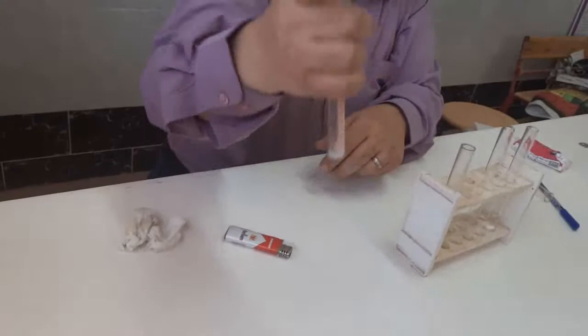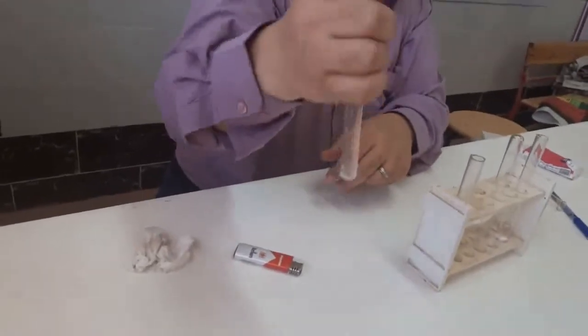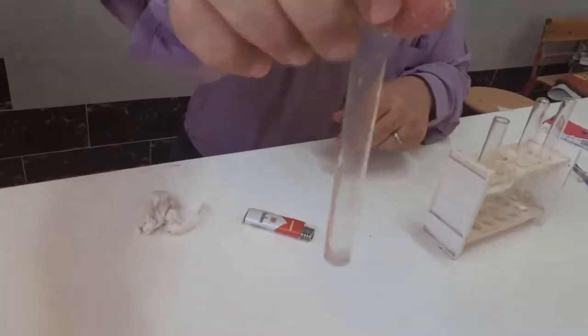We ensure that this is magnesium hydroxide, the alkaline solution.